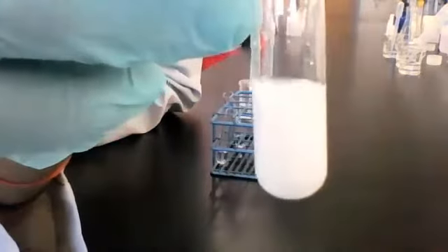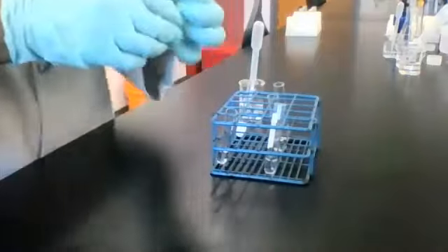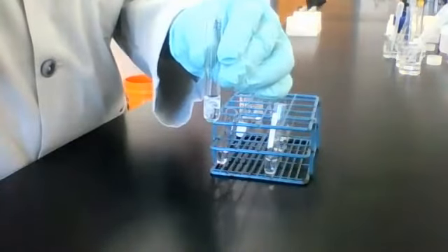And I was saying, I don't know if y'all can see what's going on at the bottom of the tube there. I'm trying to show you. All right. And here's what it looks like. This is the mixture. Okay. Let's move on to solution 2, which is sodium carbonate. We're going to add some reagent C.